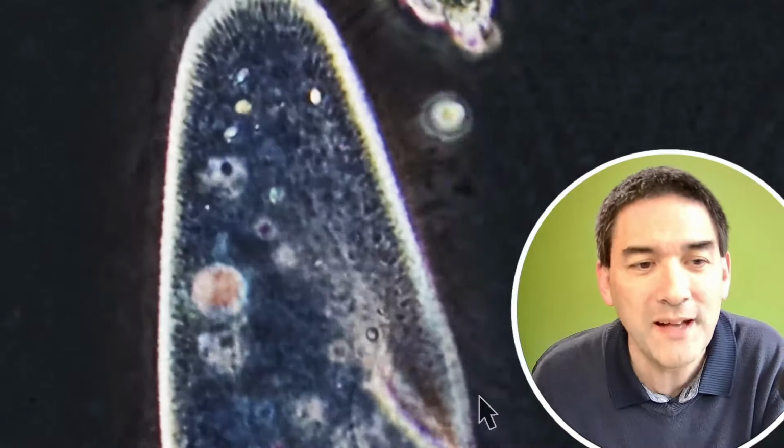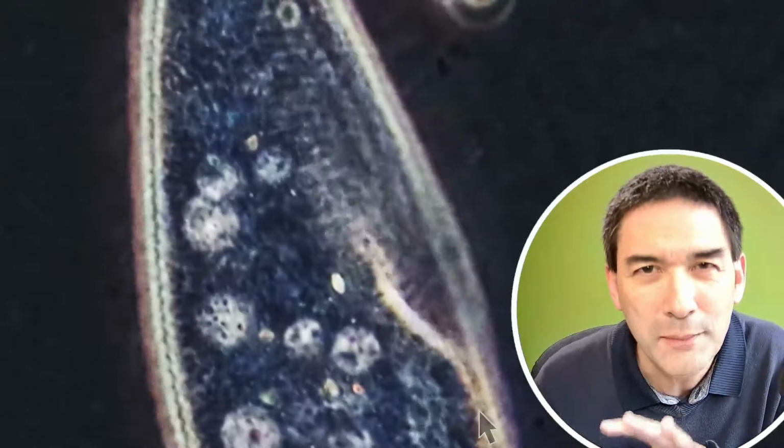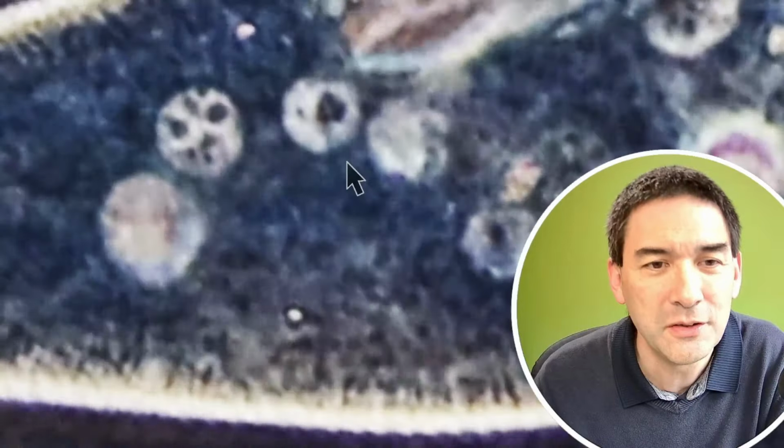It's quite fascinating. And again, the whole thing is a little bit blurry because I really zoomed in quite a bit, but still we're able to see it better this way. And last but not least, here now I really made it big. Look, this is it. That's the contractile vacuole, and see how it pulls together again, and how it is therefore able to expel all of the excess water.